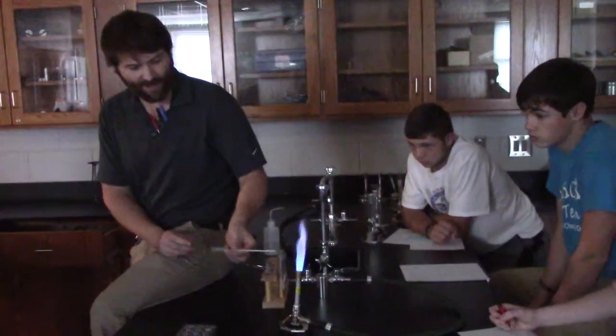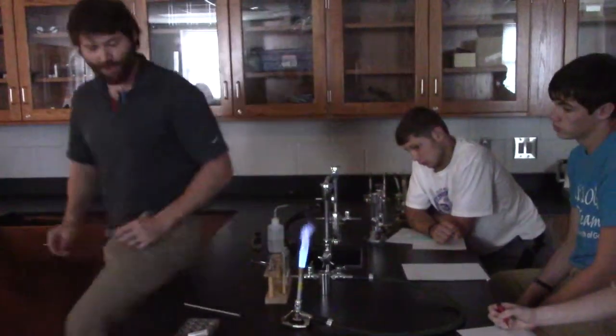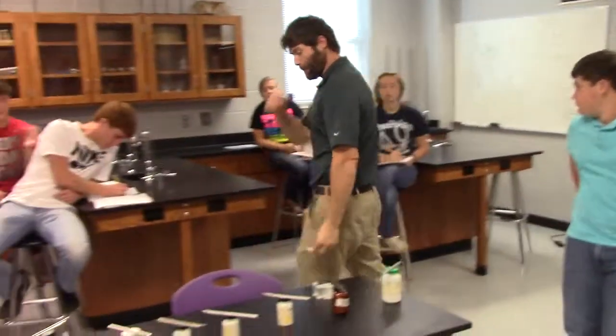Alright, so I'm going to sit here. It's clean, and then what would I do after I've cleaned it? Move on to the next one, and just repeat and repeat and repeat. What should be pretty much the last thing you do? The unknown. Amberly, if you can relight us back up. I'm going to turn off my fire. What should be the last thing? The unknown. Now, I'm going to give you a hint. The unknown should be your last, but I'm going to give you a little hint about something.